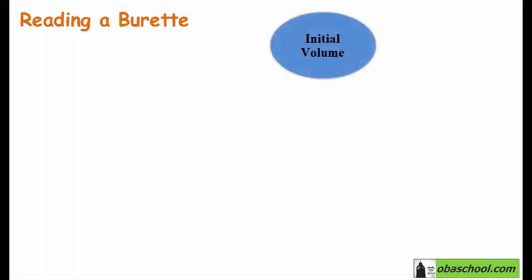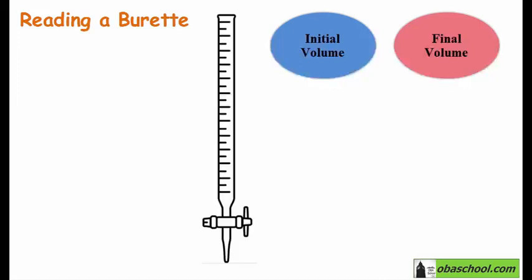Now we will practice how to read a burette. Actually, we have to take note of two volumes, which is the initial reading on the burette and the final one after we have conducted the titration experiment. So this is a burette. Notice that at the top we have the 0, and then here we have 1, 2, and 3.